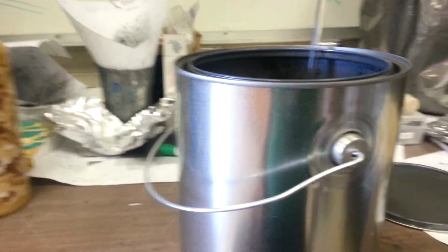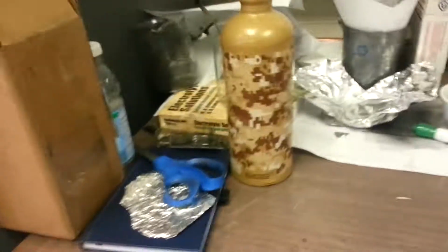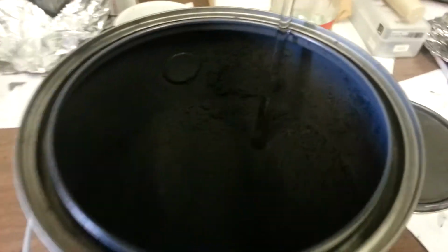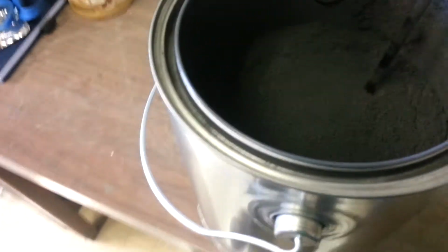Hey, look at that. This is probably one of the more quiet videos that I've taken in this lab. My desk is a mess, obviously, we all know that. But here you go. This is the proper use of a paint can. And by proper, I mean not the way you're supposed to.